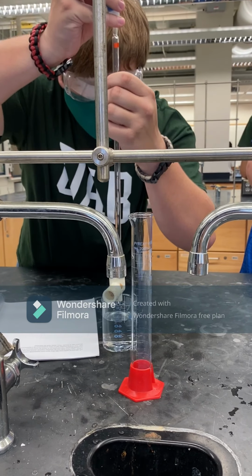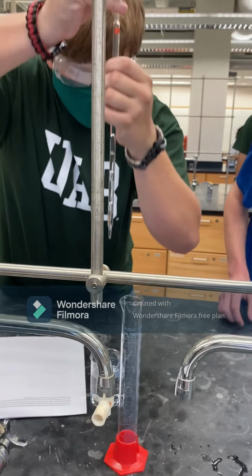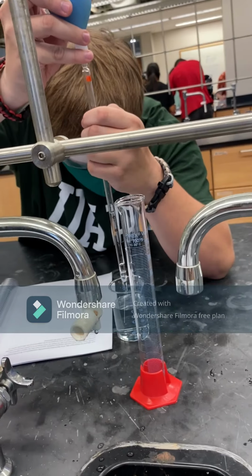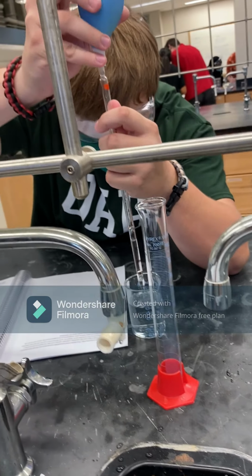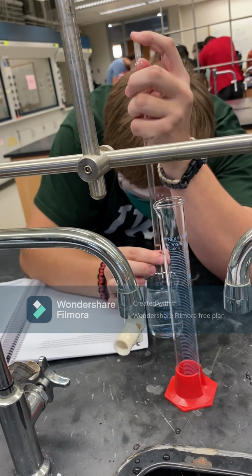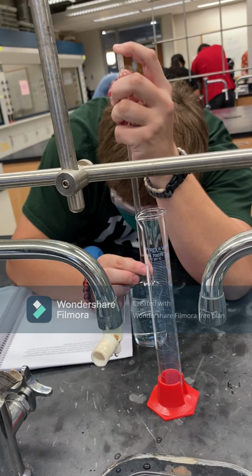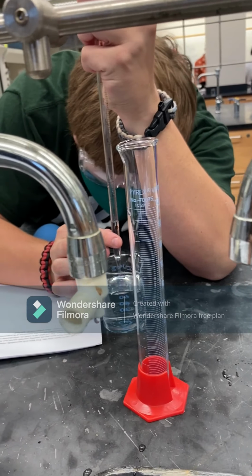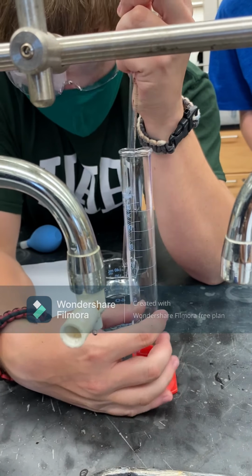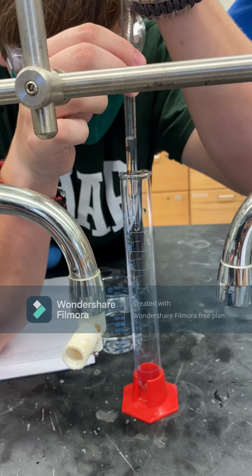Knowing what the stock solution itself and the dilution are beforehand is important in order to understand the dilution equation, which is initial molarity of the solution times the initial volume of the solution in liters. This equals the final molarity of the solution times the final volume of the solution in liters. The stock solution and the dilution itself are important as they are needed in order to solve for the final molarity of the solution. The solution is carefully measured into the pipette itself and does not reach the bulb.